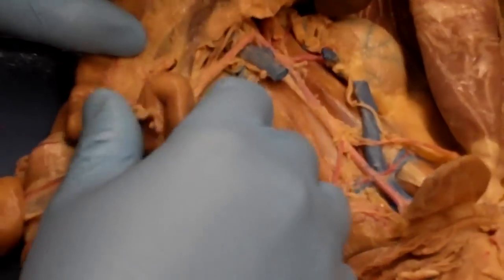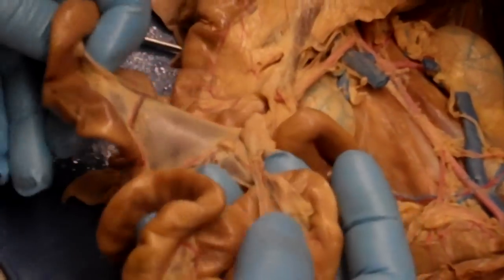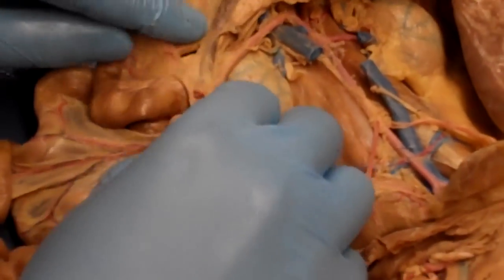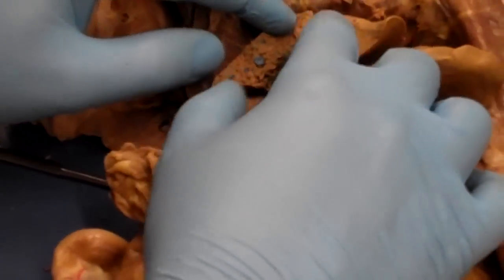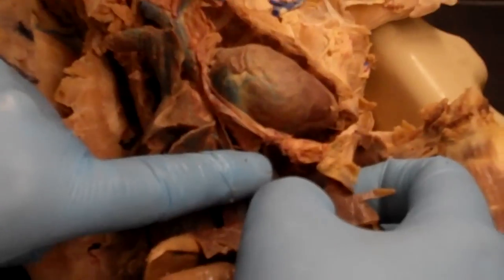But yeah, I definitely wanted to point out this portal vein right here. So you can see all these veins coming out of the small intestine. Instead of just dumping into the inferior vena cava, going back into circulation, they all coalesce into this larger vein right here. That larger vein will go into the liver, break up into a second capillary bed, and then you can see all this blue latex sort of mixed in. Those are all hepatic veins, which are going to dump directly into that inferior vena cava.